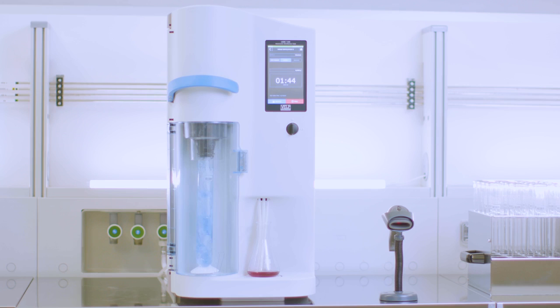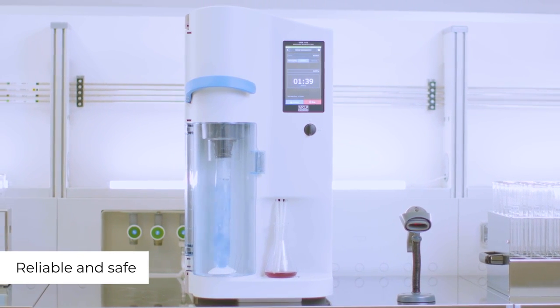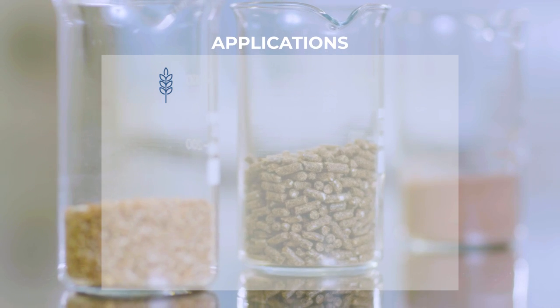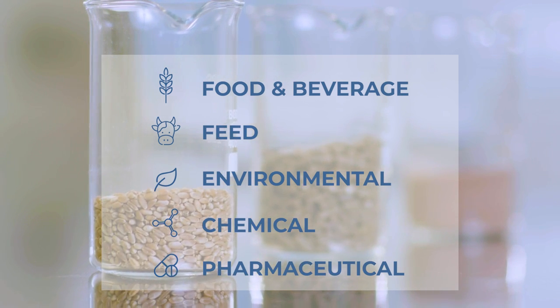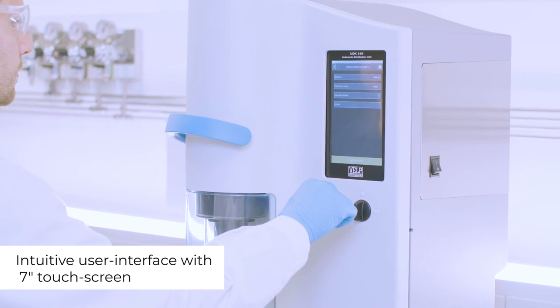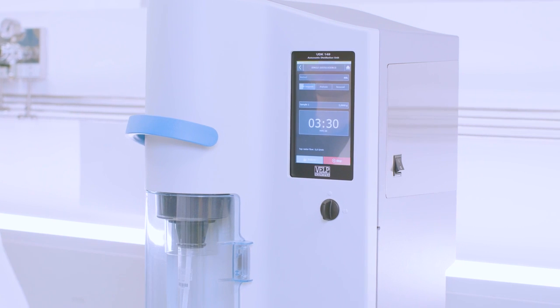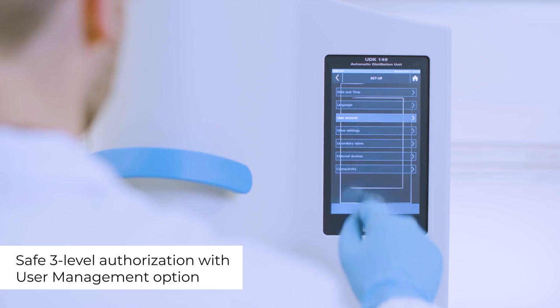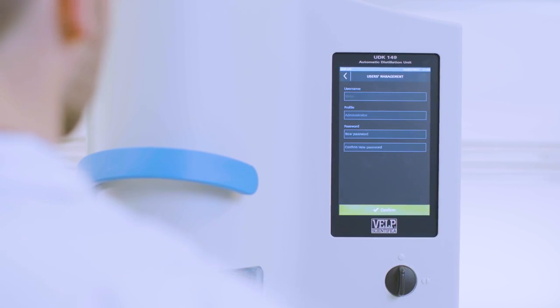The UDK 149 provides accurate, precise, and reproducible results to laboratories requiring reliability and safety in the food, feed, environmental, chemical, and pharmaceutical fields. The intuitive user interface and the bright 7-inch touchscreen make the UDK 149 a smart and easy-to-use analyzer. The user management option ensures security and compliance, granting access with 3 levels of authorization.